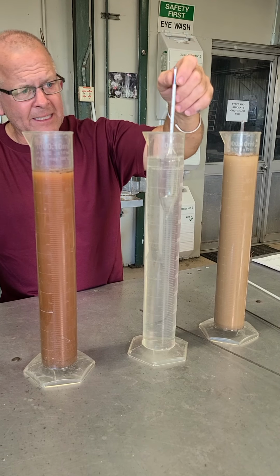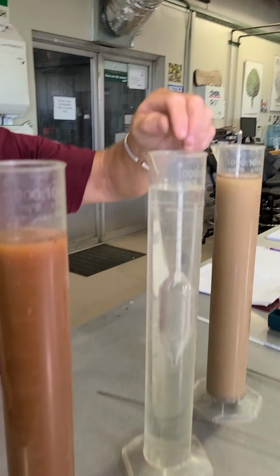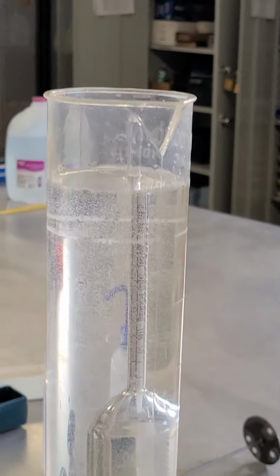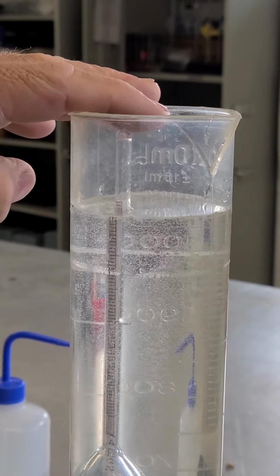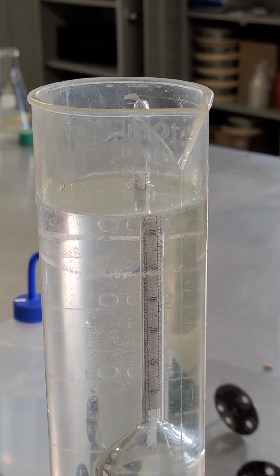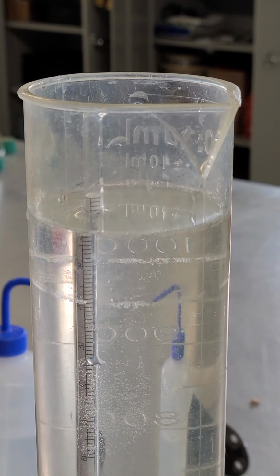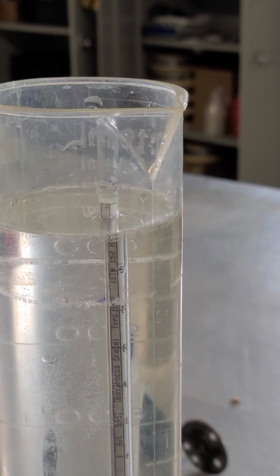Now, I've done everything the same except I don't have any soil in this one. So I can pop this one down in through there. And you can see this guy's going to settle all the way down like that. Now, it's kind of bobbing, so when it does that, you can put your finger up. Now I've got to watch for that 40-second time to come. I've got about 15 seconds left. You can see right now this is already settling all the way down. This isn't going to, there's nothing to settle. So once that stops bouncing up and down, that's going to be the reading.